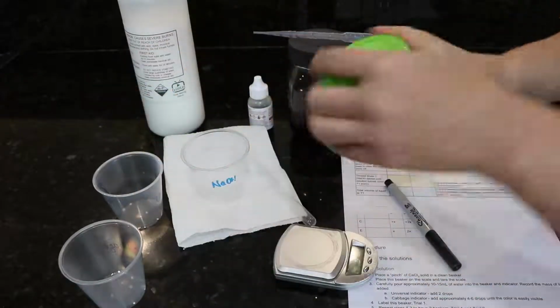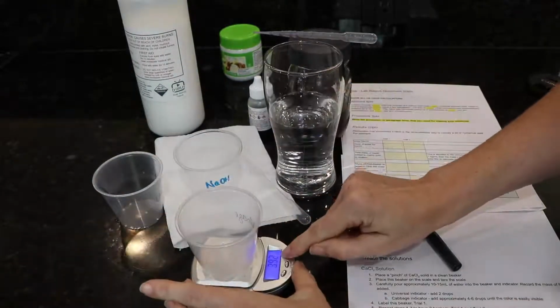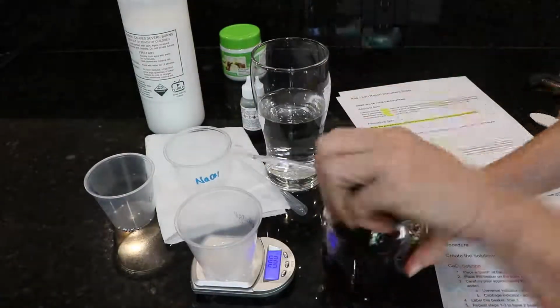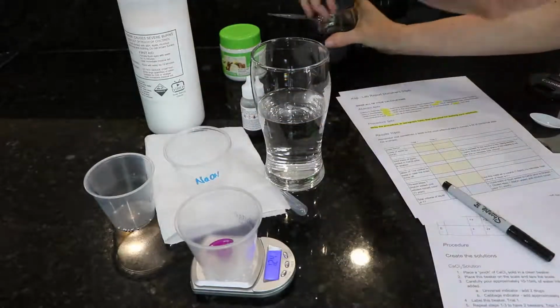And you need just a pinch of calcium chloride. You see this amount? It's actually within the error limits of your scale, so there's no use measuring it. So we're just going to put a pinch of calcium chloride in there. And then what I want is the mass of all the liquid that's going in this beaker.